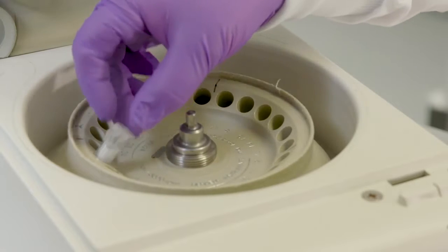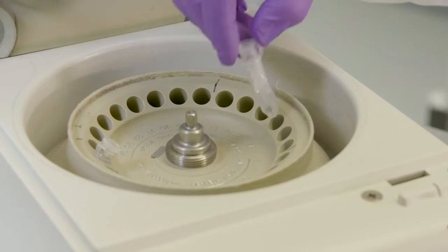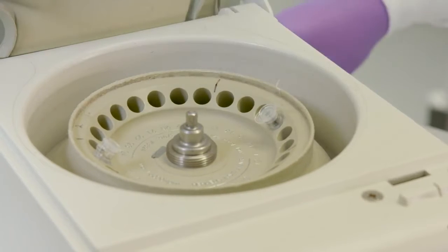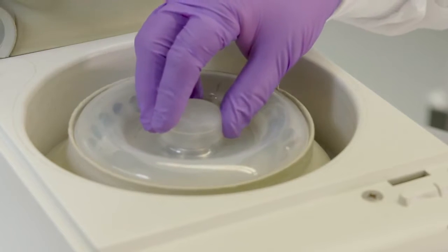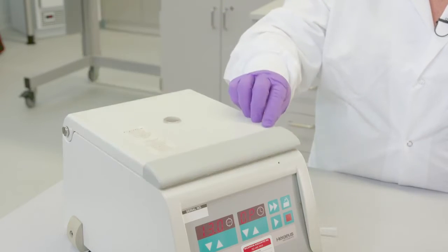To avoid damage to the device during centrifugation, check clearance before spinning, ensuring proper clearance for the full device within the rotor when the cap, centrifuge, and rotor are closed.